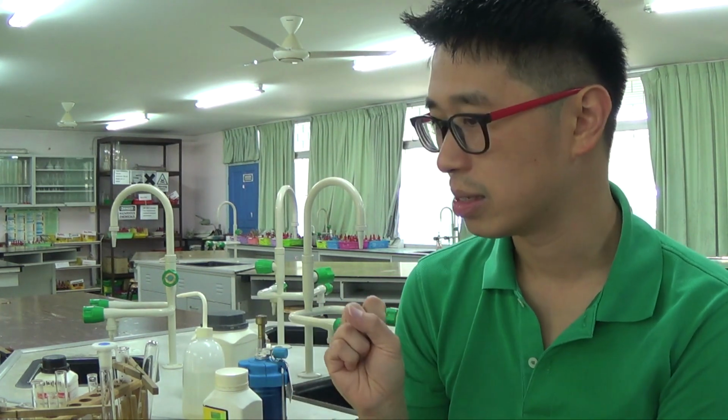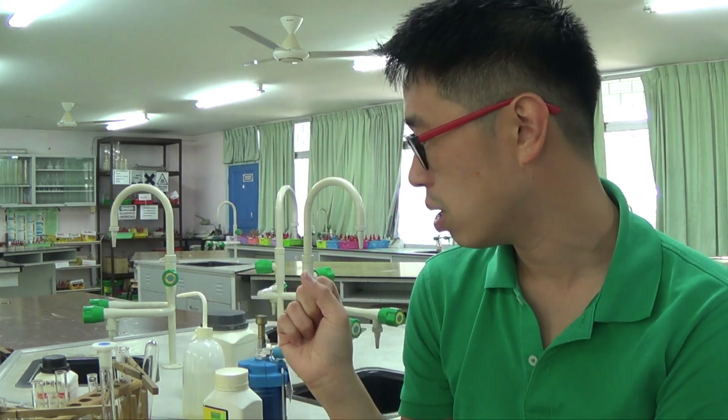And yeah, if you think I made a mistake somewhere, do let me know. I do make mistakes, such as not wearing a lab coat, such as not wearing safety goggles, but those are standards that you should do in the lab as part of the safety protocol. I try to highlight a bit of safety hazards and other things as I go along, but if you think I missed anything, let me know in the comments.